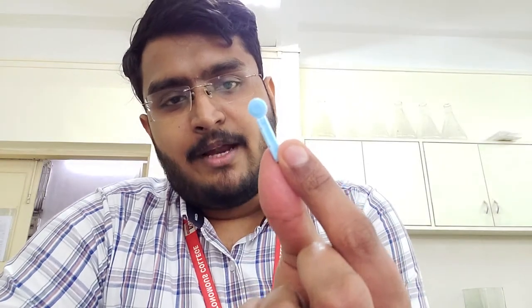Hello everyone, in this video we are going to see how to make a blood film and carry out blood staining using the Field staining protocol. Let us begin with seeing how to prick yourself using a lancet and then make a film. Here is a lancet, I'll be showing you how to use this lancet.